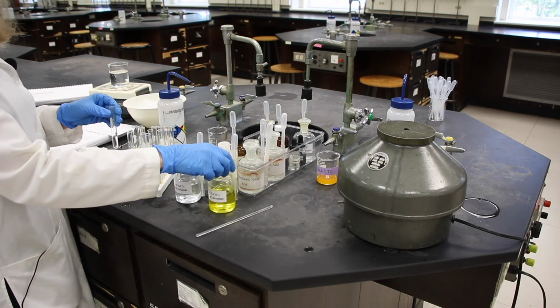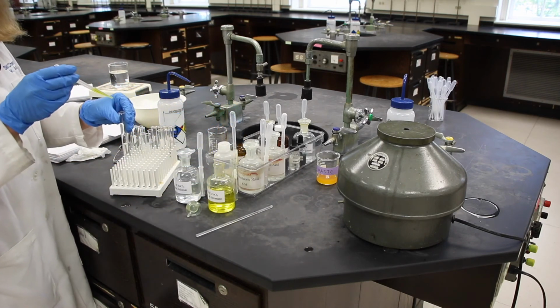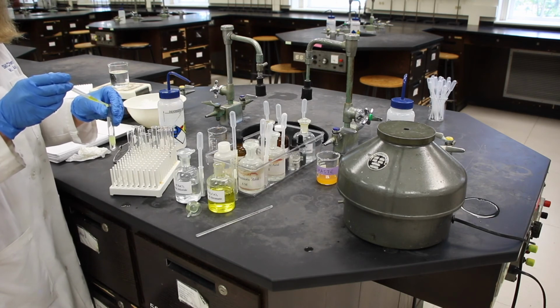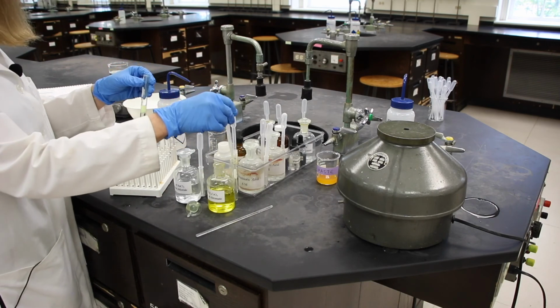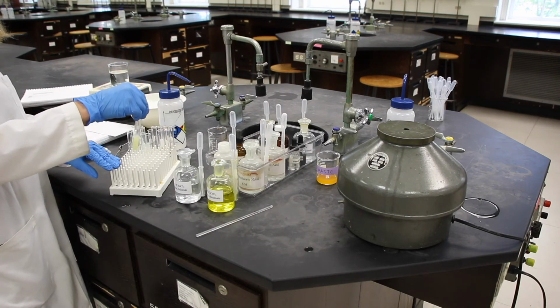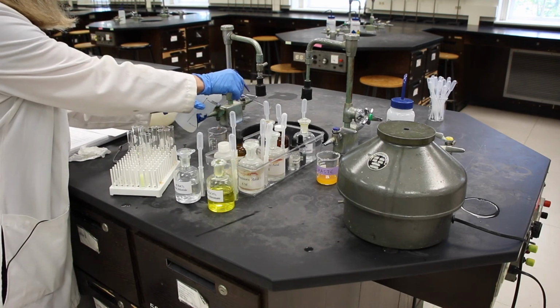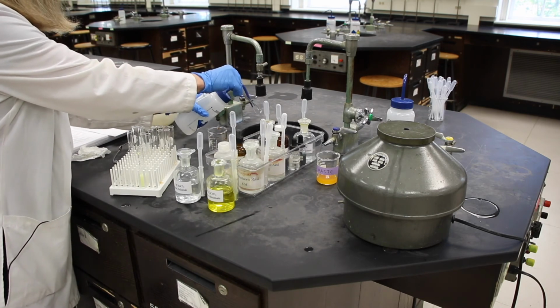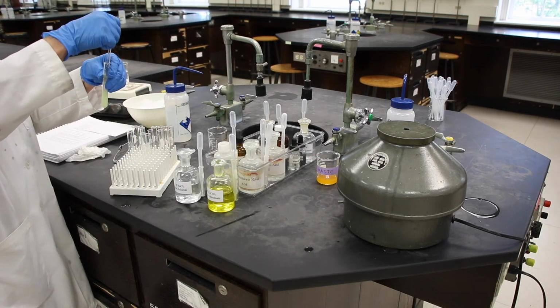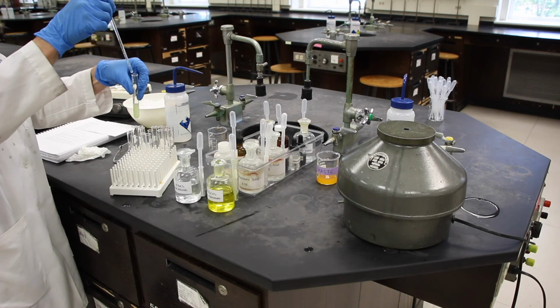And then we will add 5 drops of potassium chromate. You can see it's getting cloudy. I'm going to mix it, but it also says to mix with a stirring rod, and I use this for something else. So I'm always going to rinse my stirring rod off first. I don't want anything to contaminate what I'm doing now. Now it's cloudy, so I know there is a precipitate in there.